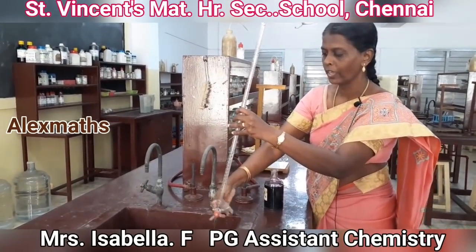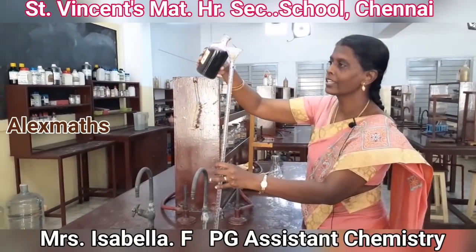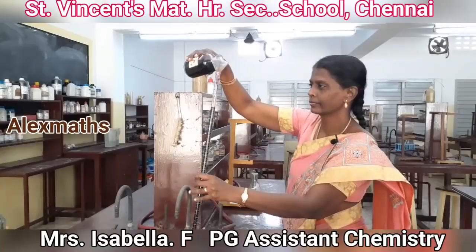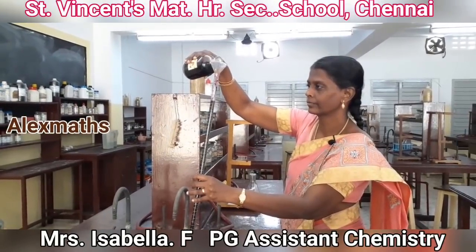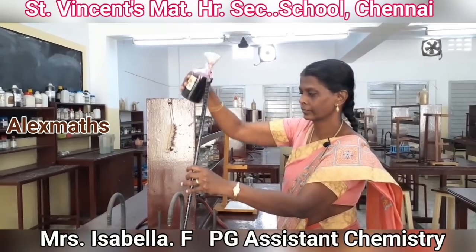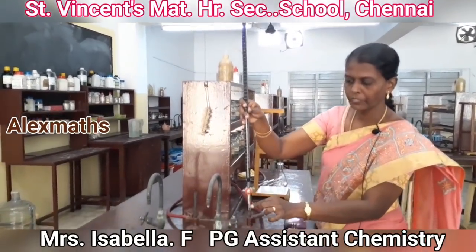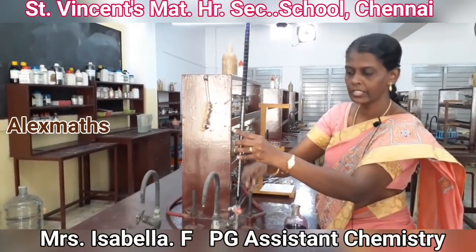After which we use a funnel and the burette is filled up to the 0 level. The tap of the burette should also be filled with the solution.